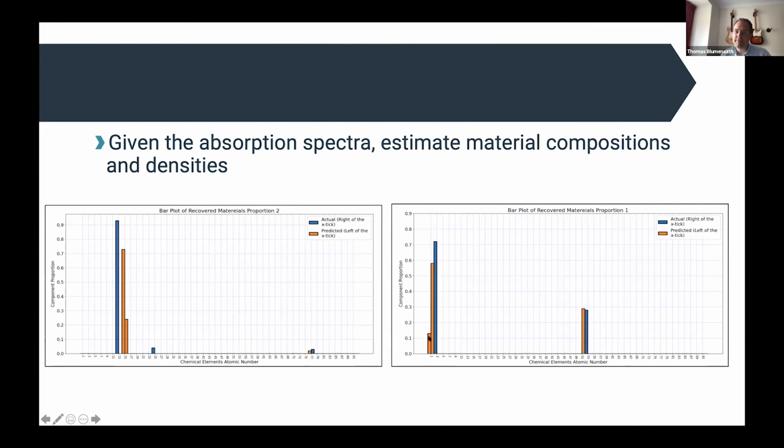And then there's also element 2 estimated rather than element 3. So a bit of element 2, because the absorption spectrum of element 2 looks very similar to element 3, and it's difficult to distinguish. But that's fairly successful. On the left, we estimated element 77 fairly correctly, but the other elements aren't right, we made mistakes. But again, we make mistakes by picking similar elements.